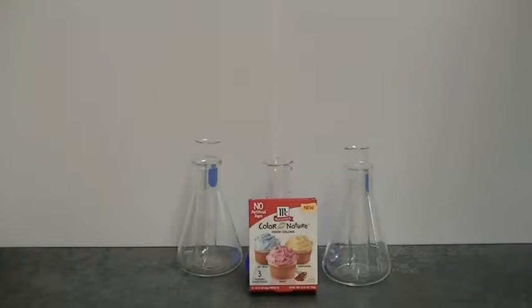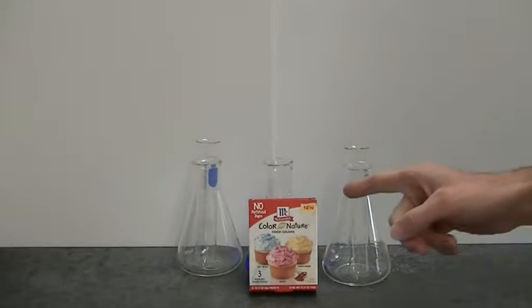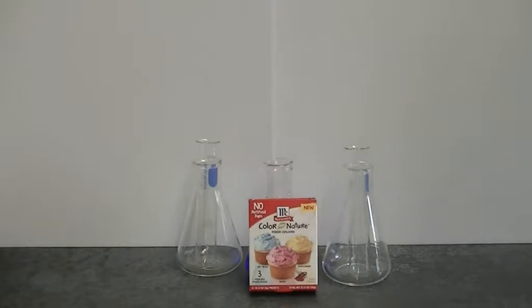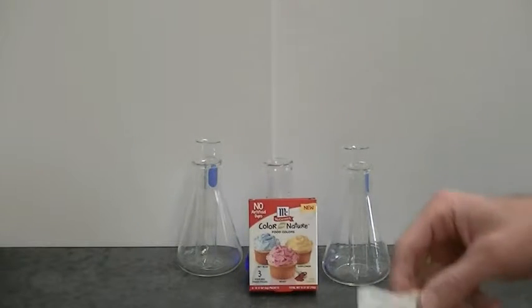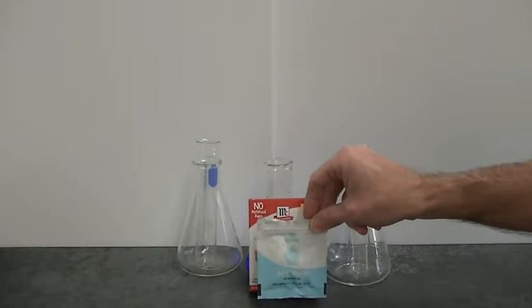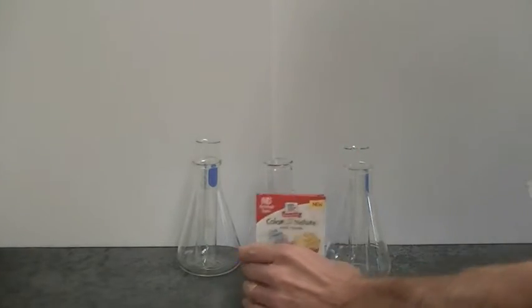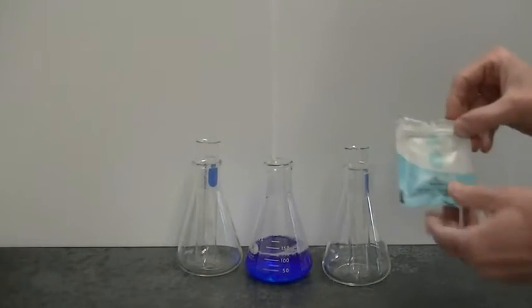I'd like to share with you a fantastically easy way to do protein denaturation experiments using Color Nature food colors. Specifically, I've taken the sky blue dye packet out of a Color Nature food color box.